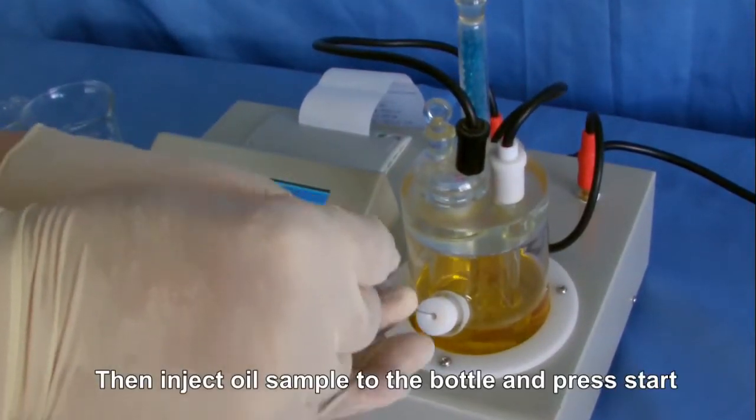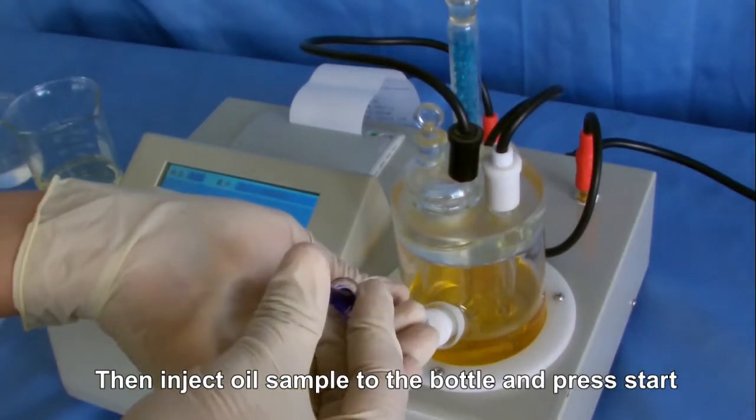Then inject the oil sample to the bottle and press start.